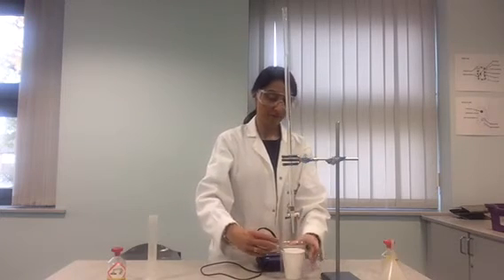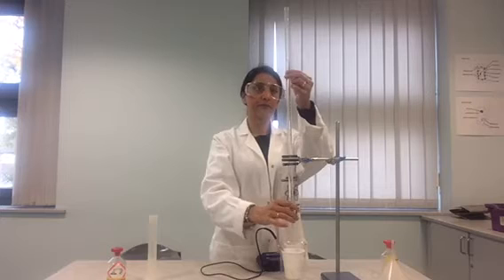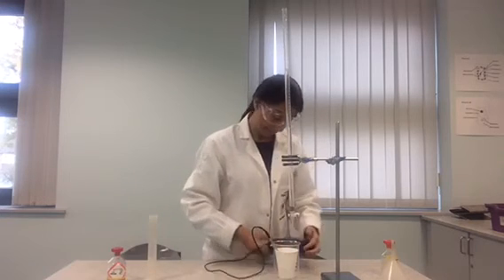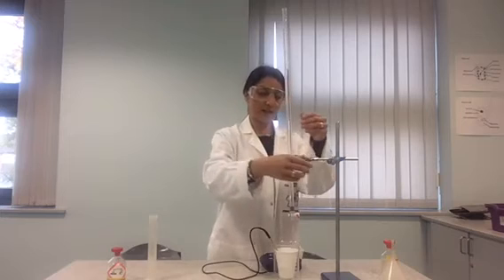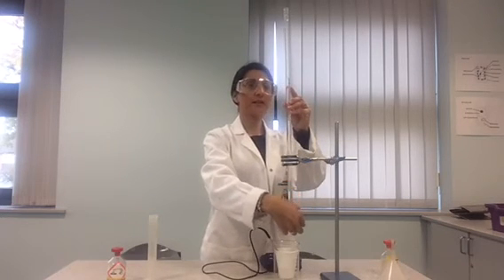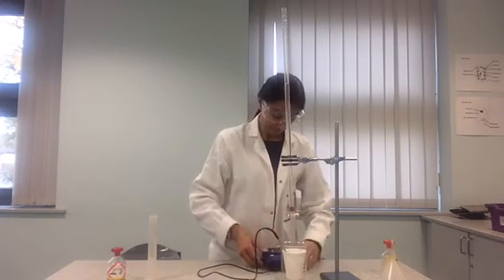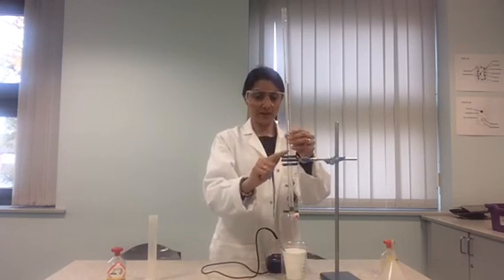Add another 5cm³ of acid, stir the reaction and record the highest temperature that the reaction reaches. Continue adding acid at 5cm³ intervals, recording the highest temperature at each interval to determine if the reaction is exothermic or endothermic. You will need to add a total of 40cm³ of acid and then repeat the experiment twice.